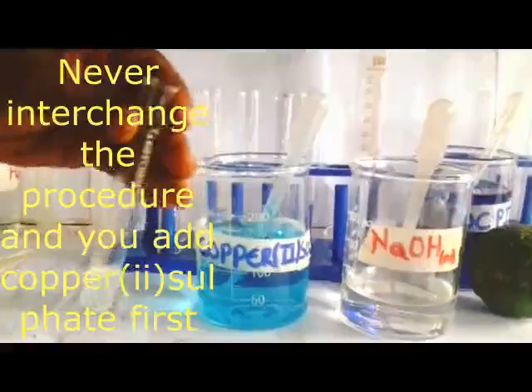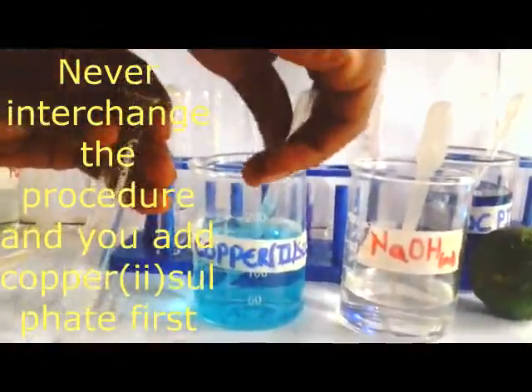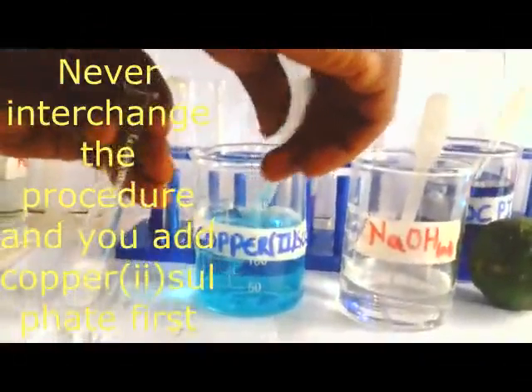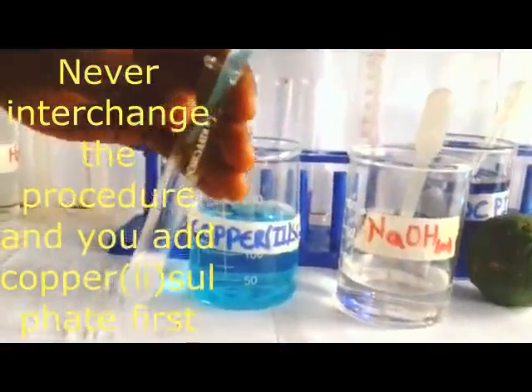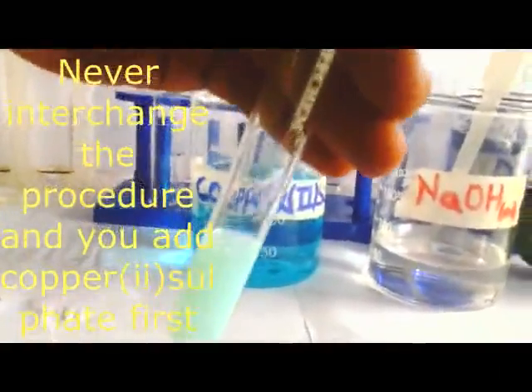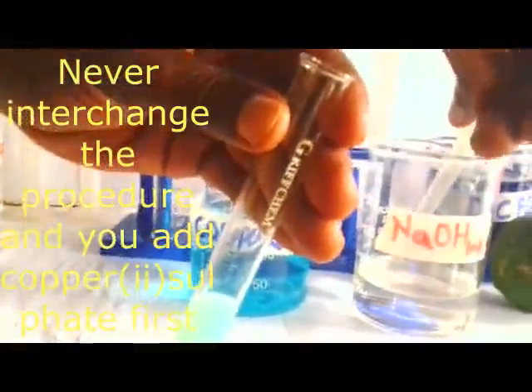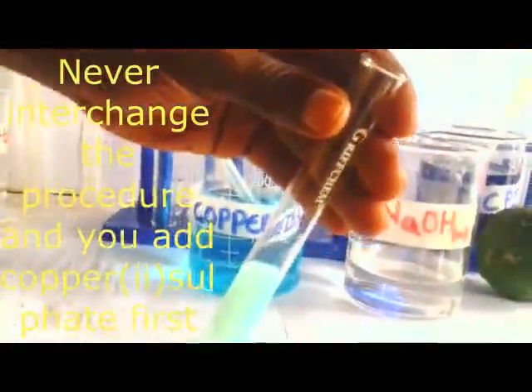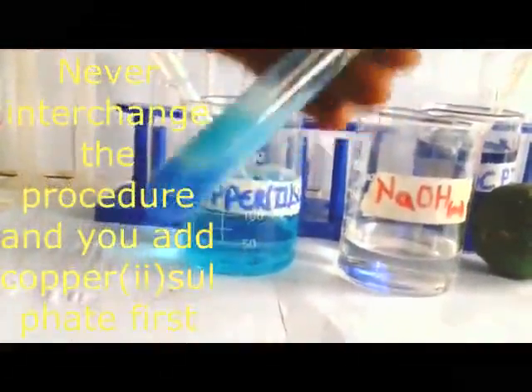Then I add copper 2 sulfate first. Let me do the opposite now. I'm adding copper 2 sulfate first. That is the one I've added. Then I'm adding sodium hydroxide last. I'm interchanging the procedure to show you what is going to happen. Then I add my sodium hydroxide.